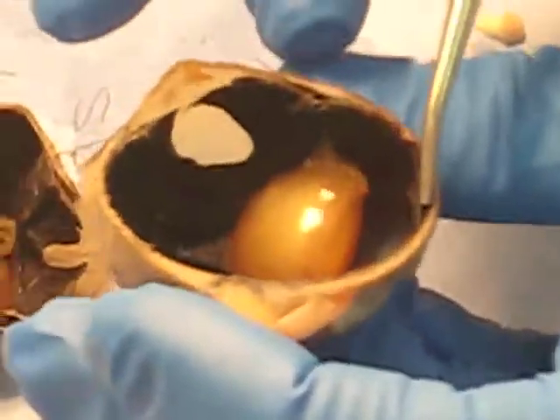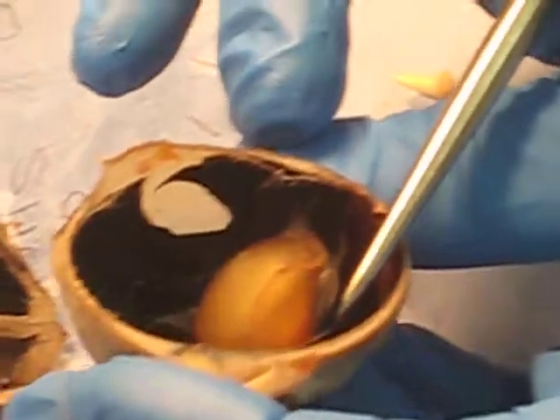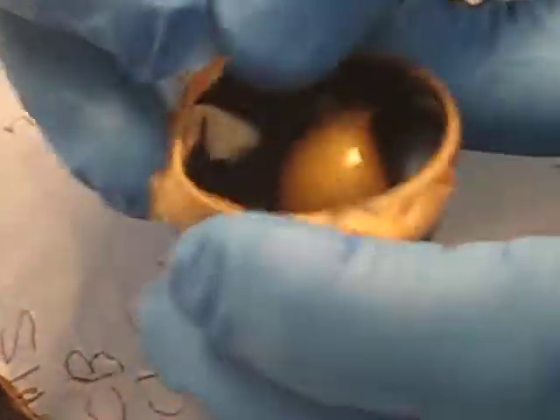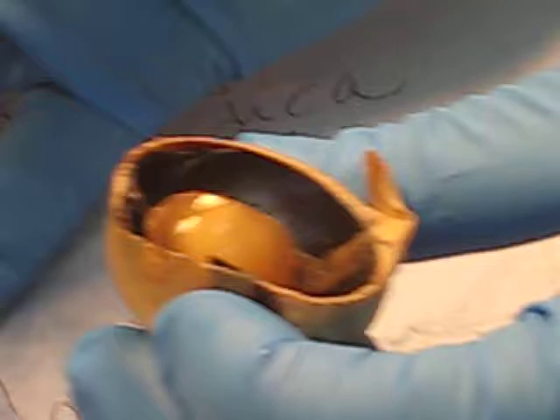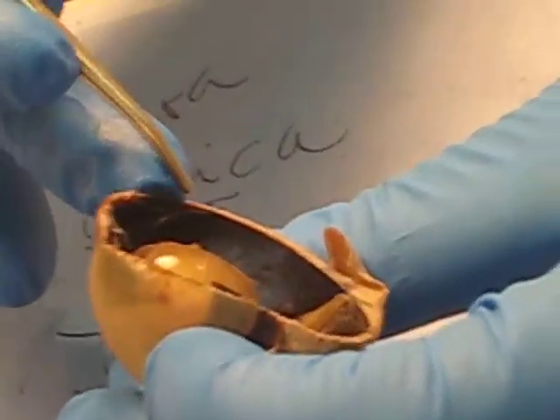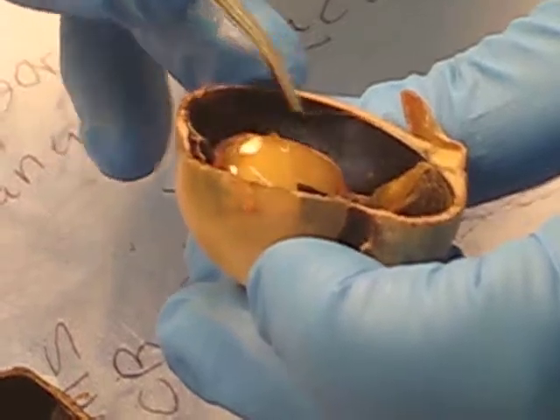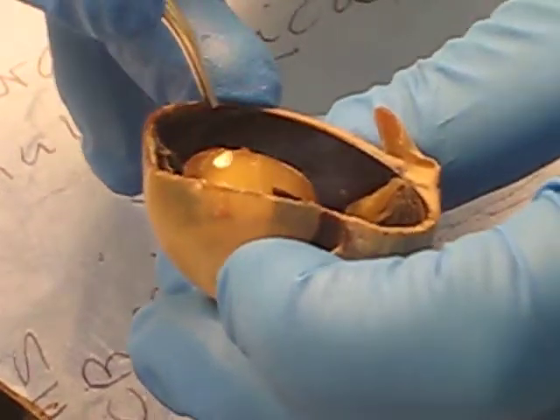So I'm peeling the choroid away from the sclera, and if you look, you can see this bluish structure here, which we call the tapetum lucidum. That moves when I wriggle the choroid, so you know that it's part of the choroid.